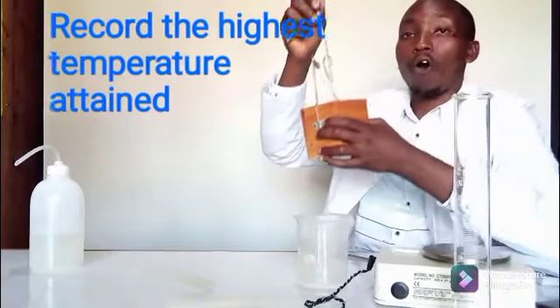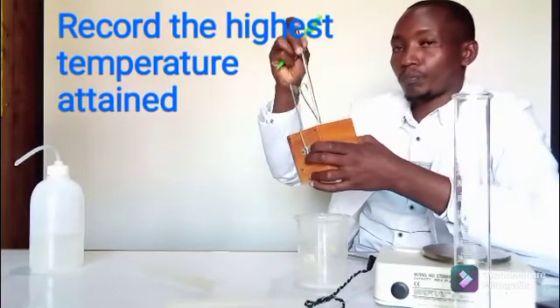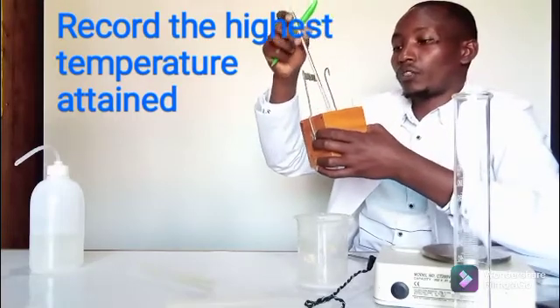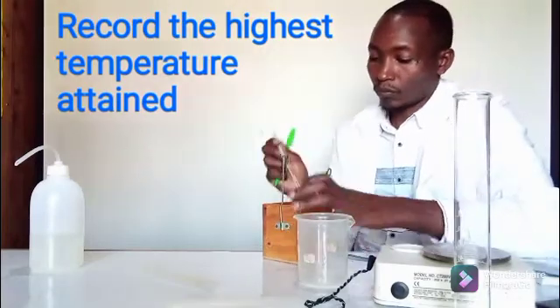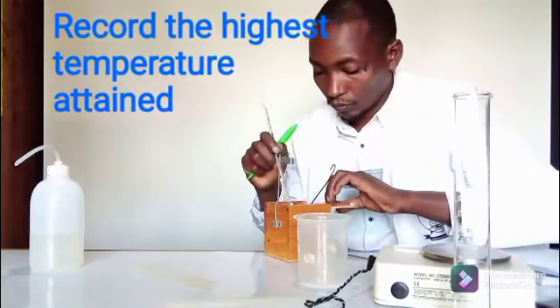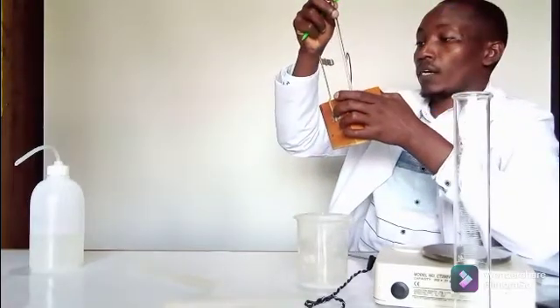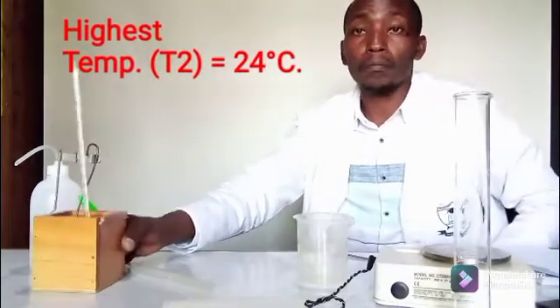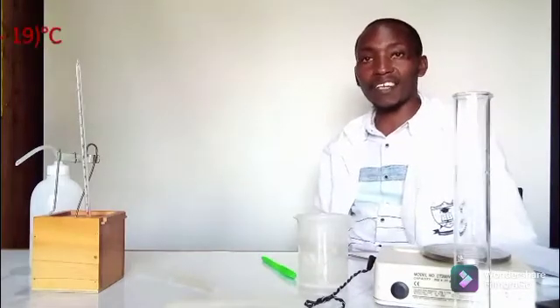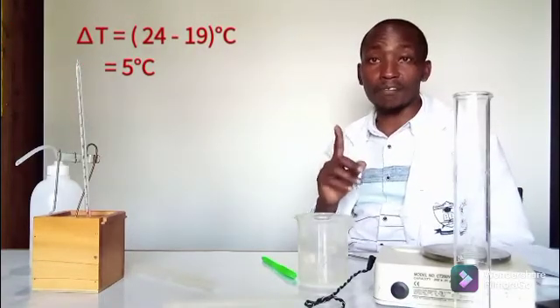The temperature now stands at 24.0°C. The solid has all dissolved and the temperature remains at 24.0°C. So the change in temperature is the highest temperature minus the initial temperature: 24 minus 19, giving a temperature change of 5°C.